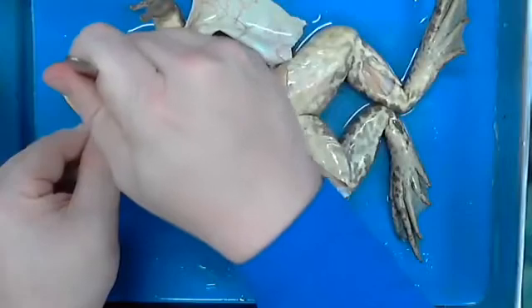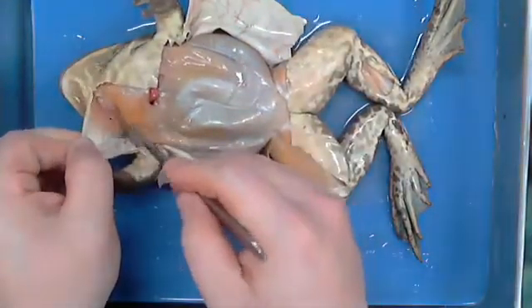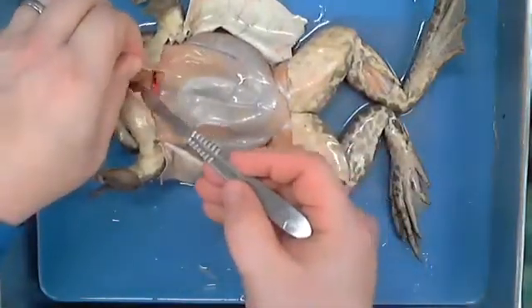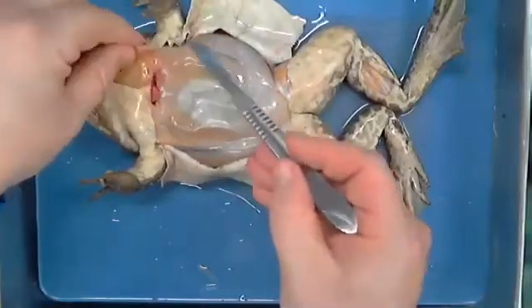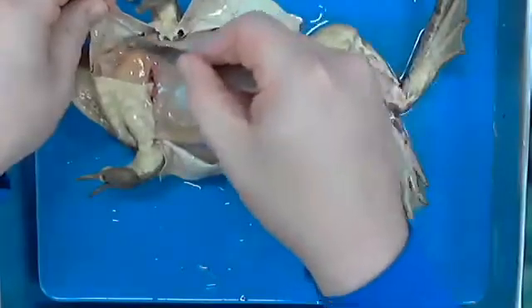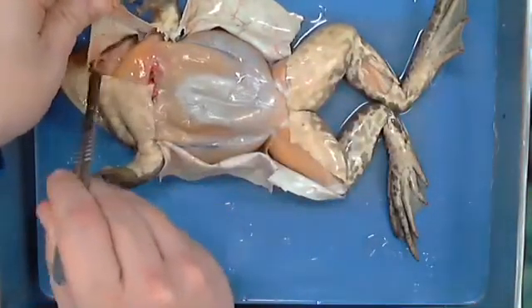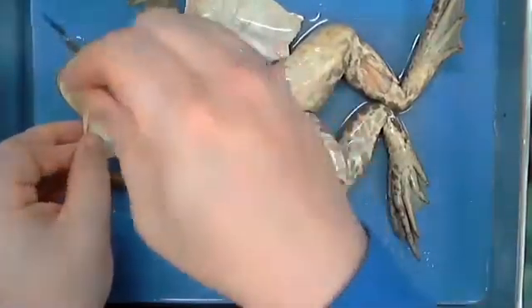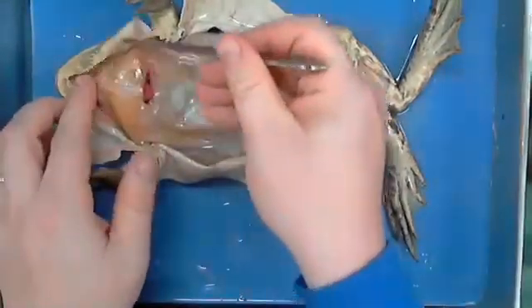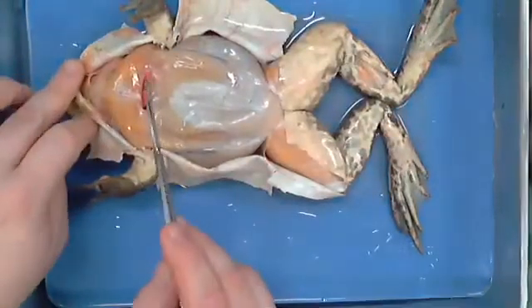Because it's up towards his throat area. What would be up here that would be hard? Windpipe. His teeth. What do we have that protects all of our major vital organs? Ribs. Bones. All right, so ribs, basically bones, right? We have the same thing that you've got from the standpoint of we are protected by a rib cage. The reason why is because of what we have in our bodies that's in this place that's so important. That would be obviously lungs and heart.